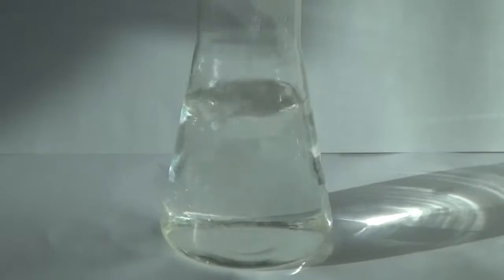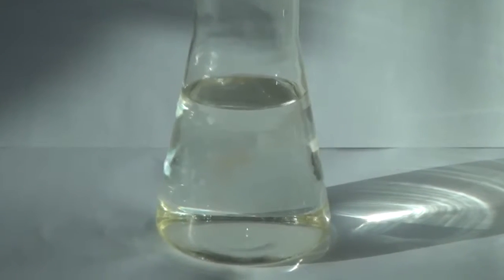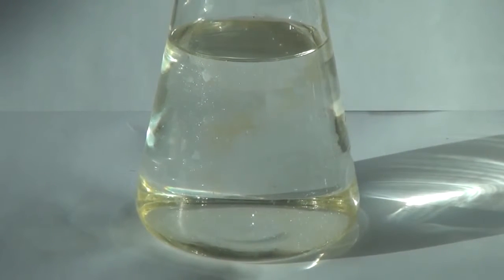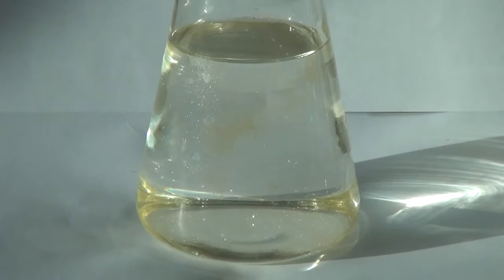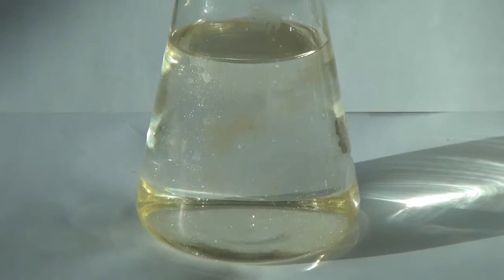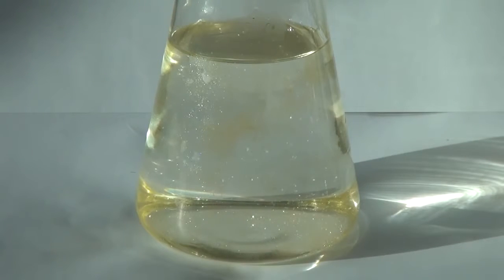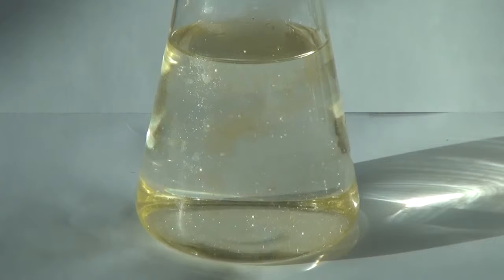Over time, the solution cools down and out of it the beautiful flakes of lead iodide will start crystallizing. The slower the cooling process, the larger and more beautiful the lead iodide flakes are going to be.